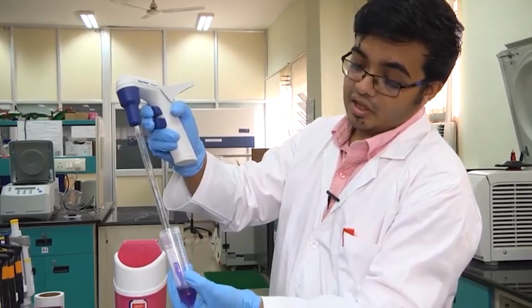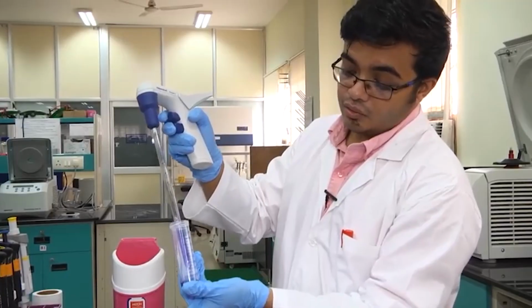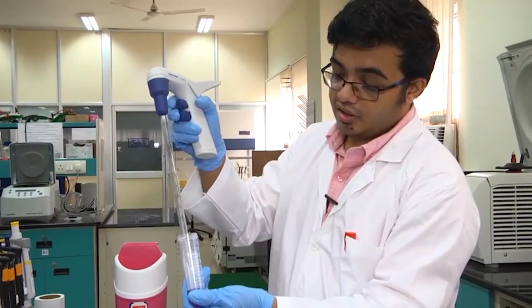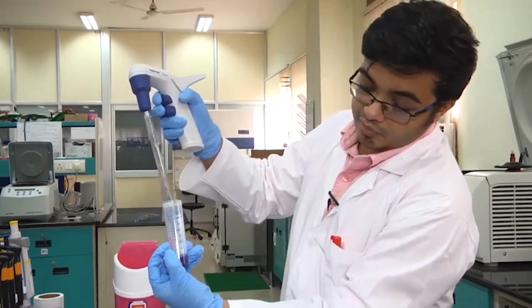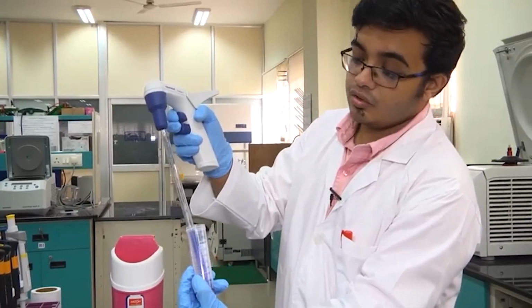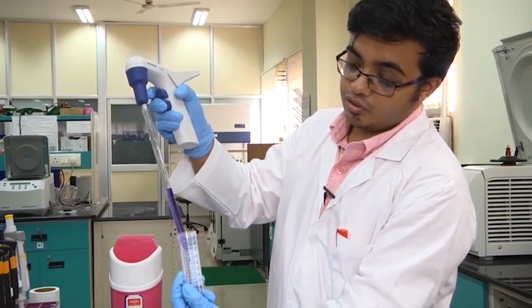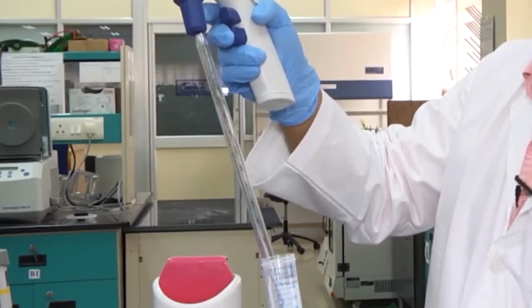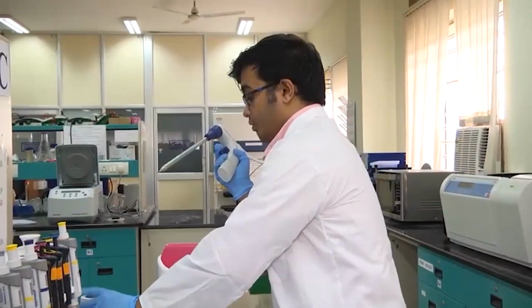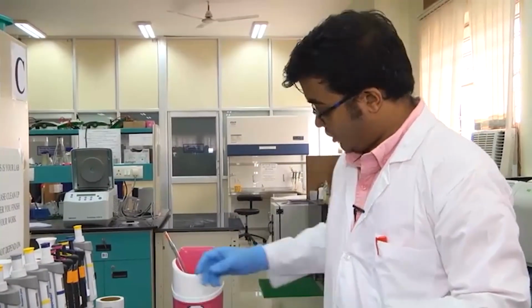Let me show it again. I am collecting the liquid. Oh, see, I was talking about an error, right? If I do not dip it properly, you saw what happened, air bubbles entered the serological pipette. So, I do not want that. So, dip it in nicely, I am sure it is visible now. Dip it in nicely and go at a uniform pace. You are collecting the liquid and dispense slowly. You can dispense drop by drop, or if I increase the pressure, I can dispense the liquid as a jet. So, this is how we use pipette controllers to pipette out comparatively larger volumes of liquids.